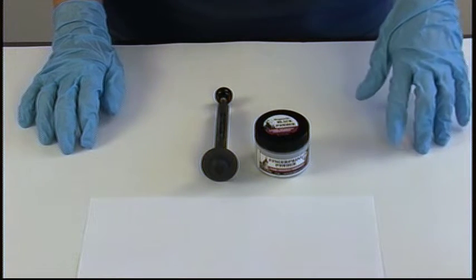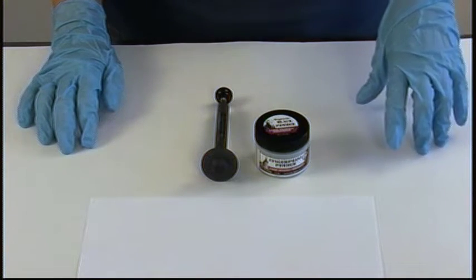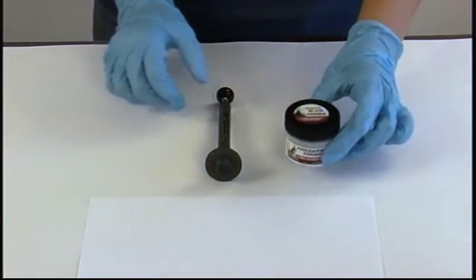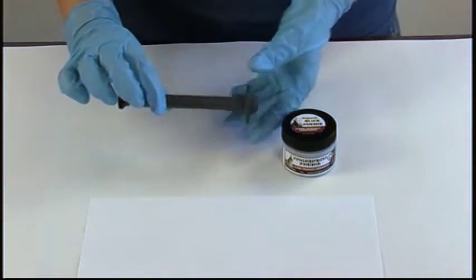For this video, we're going to be developing latent prints with magnetic powder. The tools we'll be using are magnetic powder and the magnetic powder wand.